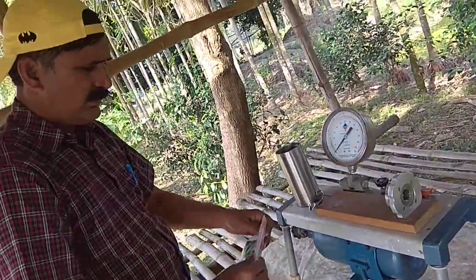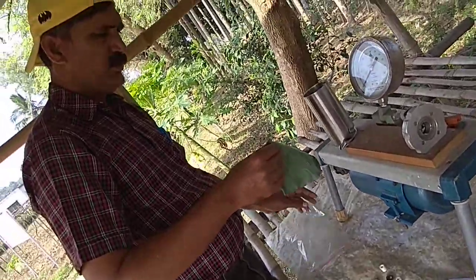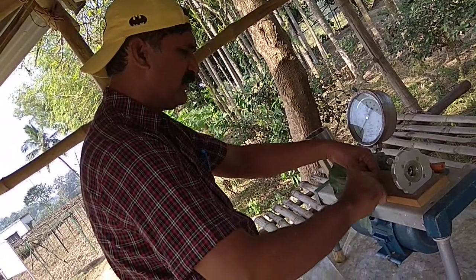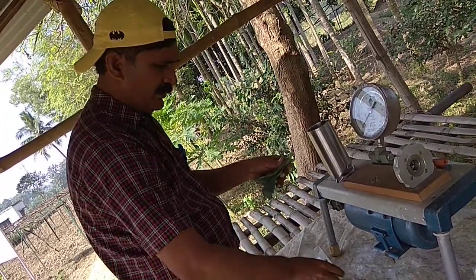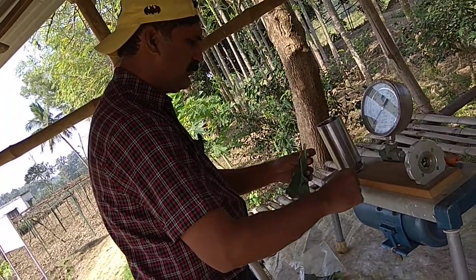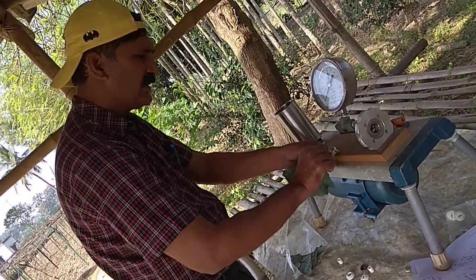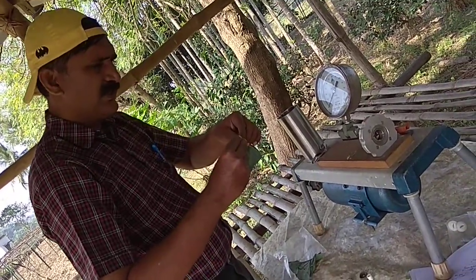Then you take the leaf sample, remove it, and take the cut. This is a midrib, because the petiole size is very big. We are taking this midrib. This should be inserted in this rubber packing so that the gas will not leak. Oh, it's again a big size. You have to reduce it. So insert like this.